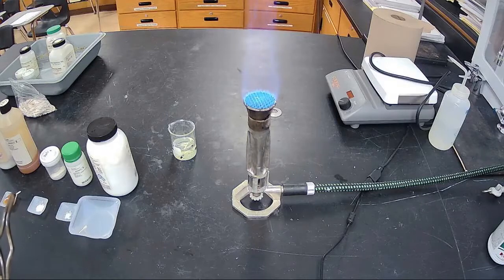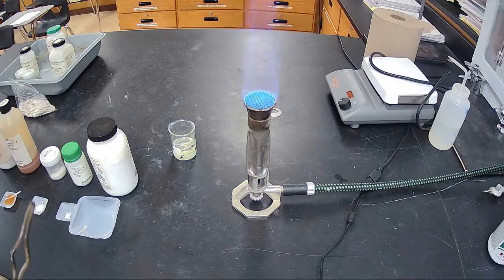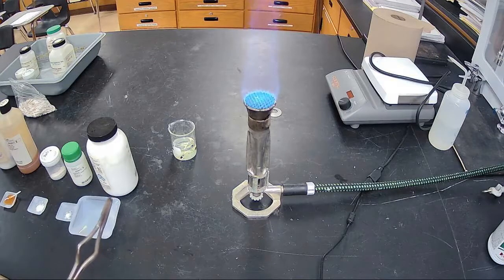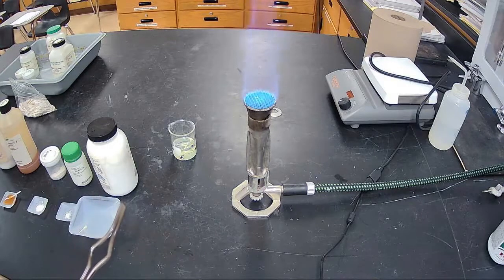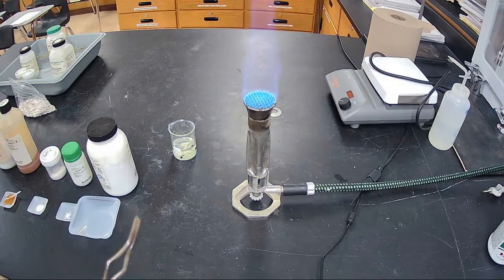It's kind of like a fingerprint, where you get to see the characteristic color for every metal that is inside a compound. So we have the different compounds that we're going to be putting in there, and they'll all have a wavelength and a frequency with them. You'll be able to calculate the wavelength and the frequency from the picture. So you'll be able to find the wavelength associated with the color, use the wavelength to find the frequency using the speed of light equation. Once you have the frequency, you can also calculate the energy of that particular salt, using E equals hν, Planck's constant times your frequency, to get the energy of the salt. So you'll be able to do that.